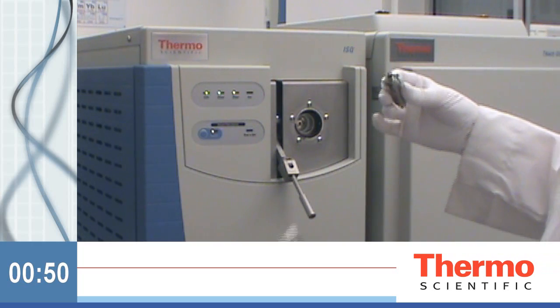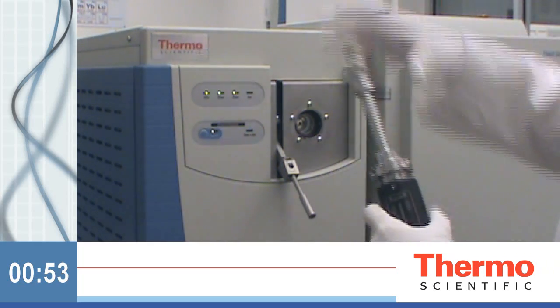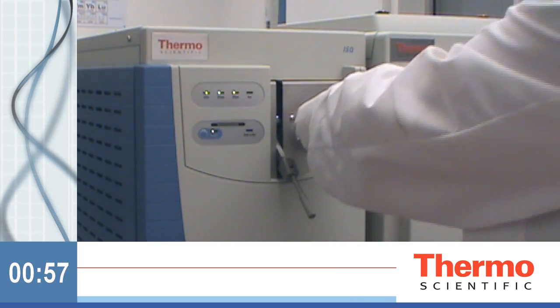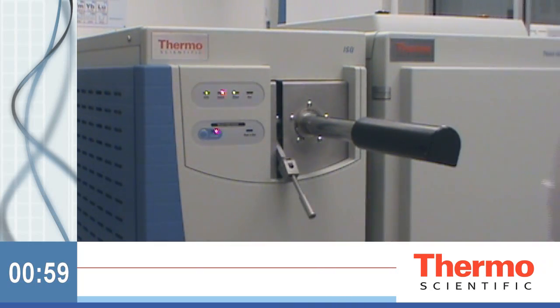Replace the source with a clean source and reattach the source removal tool to the ISQ valve. Evacuate the air between the tool and the valve.